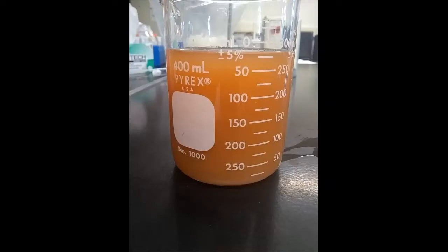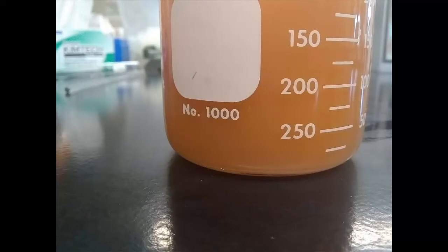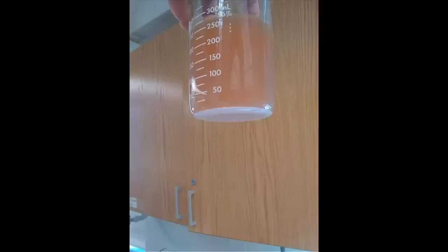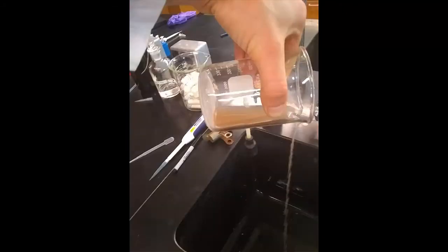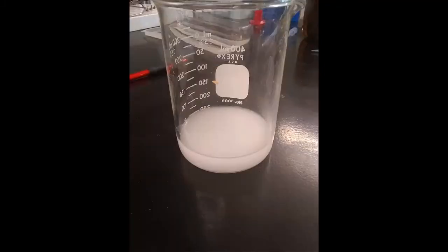Rather than show a long portion of video, we let it settle for quite a bit of time. And you can see at the very bottom of that glass, there's actually a white layer of starch. You can't see it super clear. So here's a lifted version of the glass where the starch is actually settled to the bottom. This is decanting that top layer, leaving the bottom layer.